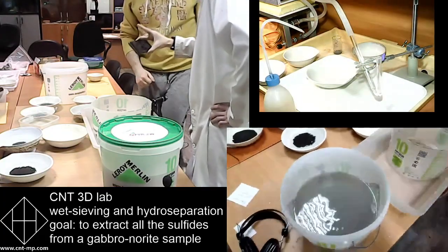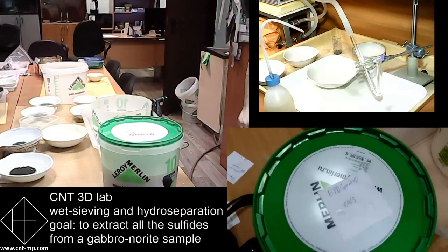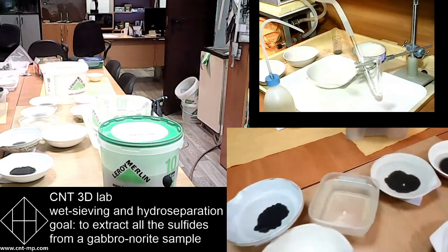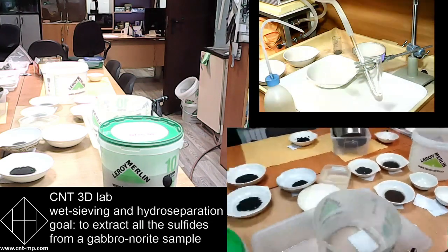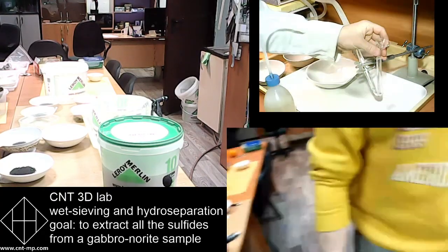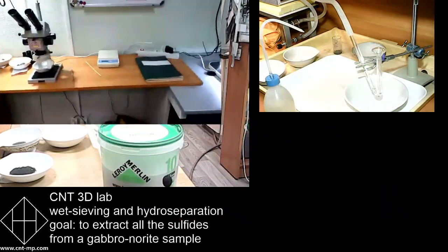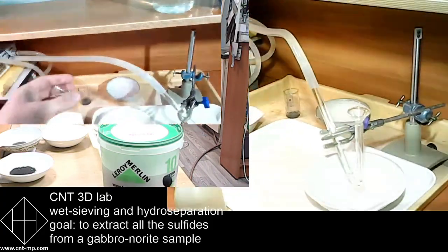So we now have all the size fractions throughout the whole set. That's the finest one in that bucket. It's a little bit more water than needed, so we tag it and place it for particle settling in this bucket, maybe overnight, maybe less, but we want all these particles to settle down, reject some water, and use it for further hydroseparation.